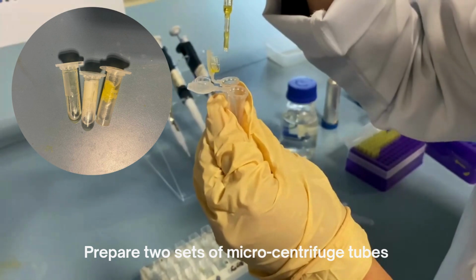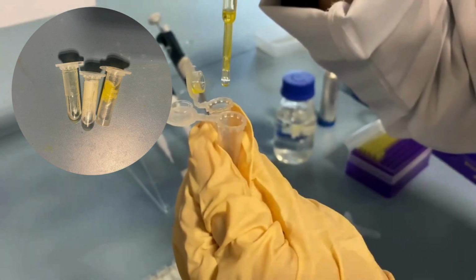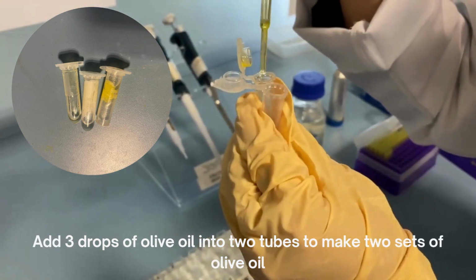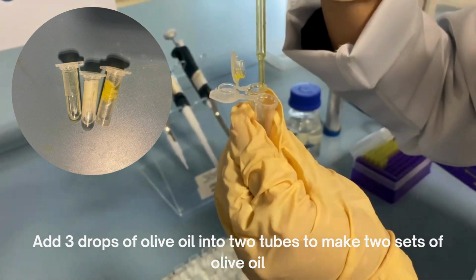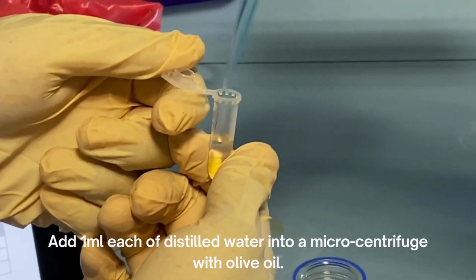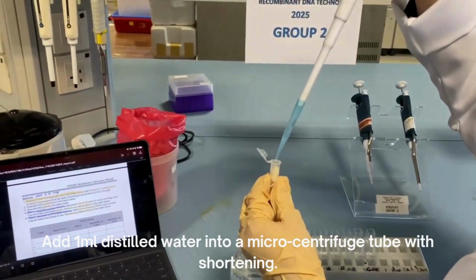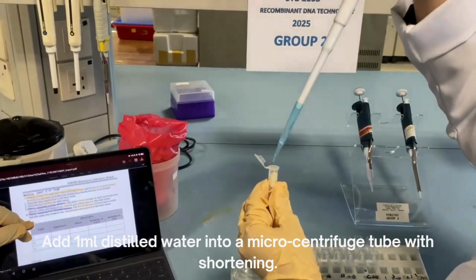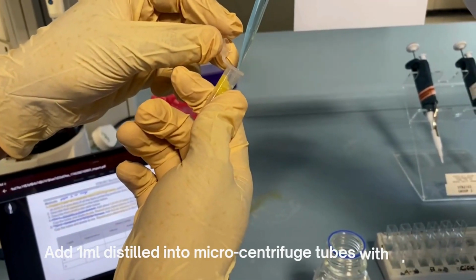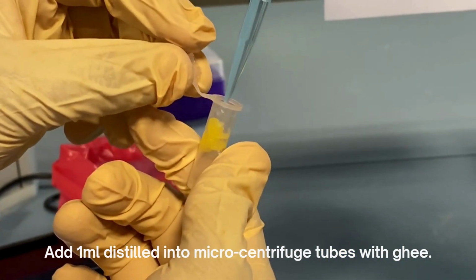Prepare 2 sets of 3 microcentrifuge tubes. Add 3 drops of olive oil into 2 test tubes to make 2 sets of olive oil. Add 1 ml distilled water into 1 tube with olive oil. Add 1 ml distilled water into 1 tube with shortening. For the last tube with ghee, add 1 ml distilled water.